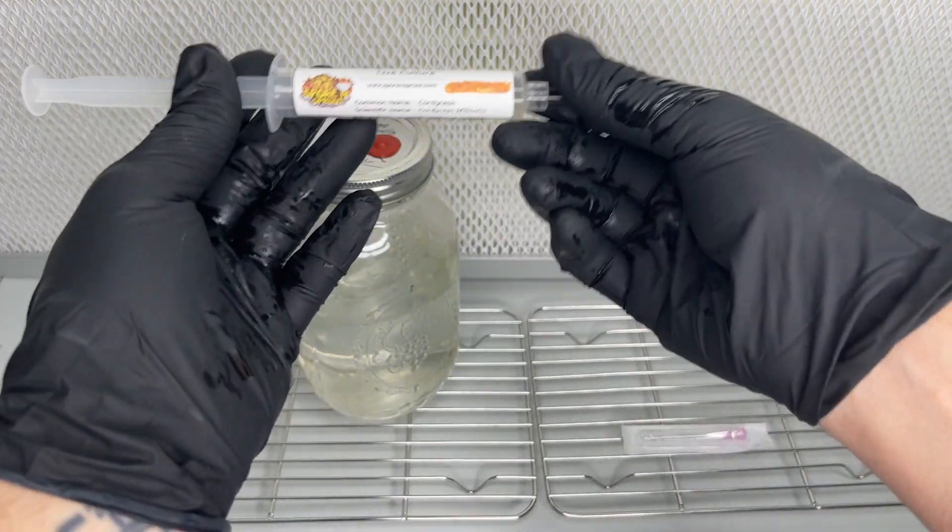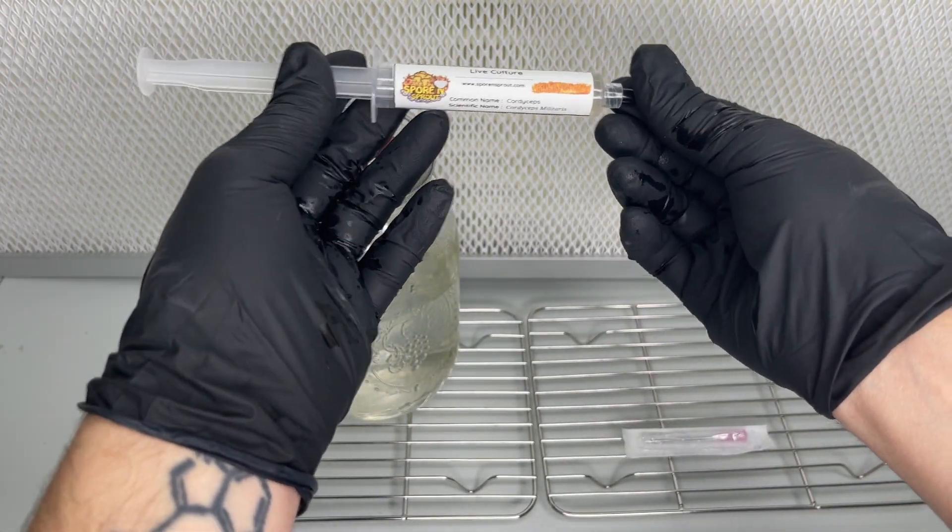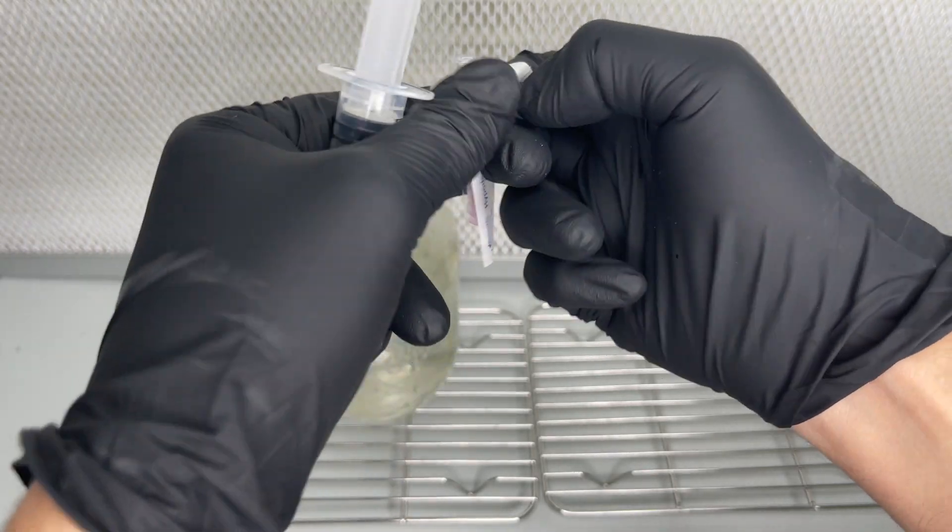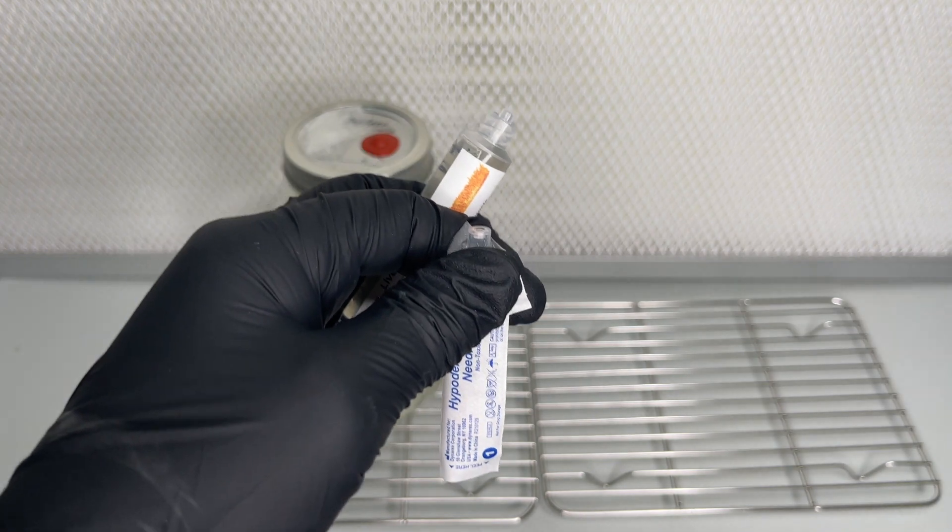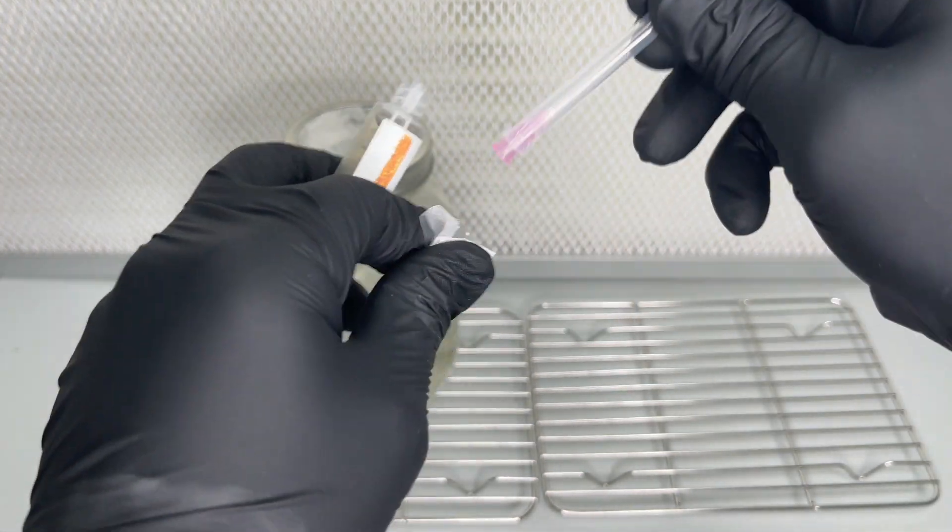Now the jar is ready to be inoculated with spores, agar wedges, or liquid culture. I just went ahead and inoculated it with some cordyceps militaris liquid culture.